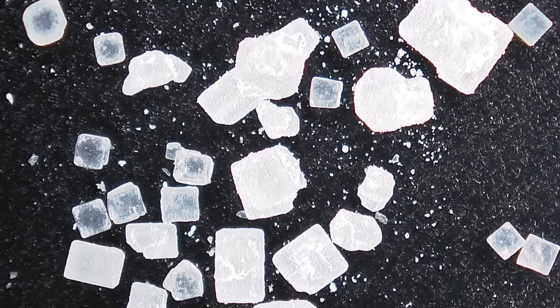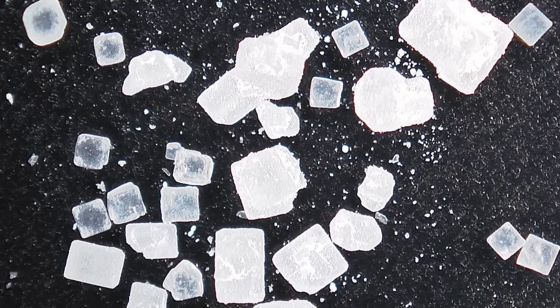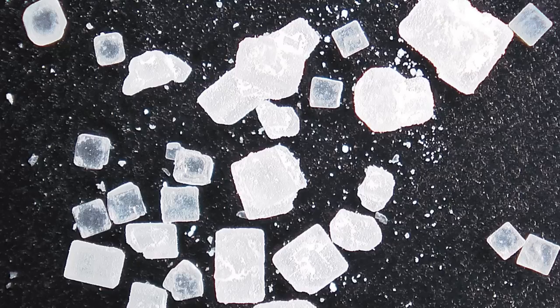We're about to reveal the answers from last week's video, so if you haven't watched it, you might want to go back and watch it now. Otherwise, image 1: this is a mixture of salt and sugar. The salt crystals are the ones that are more cubic and translucent, and the sugar ones are the ones that are more blob-like and opaque.